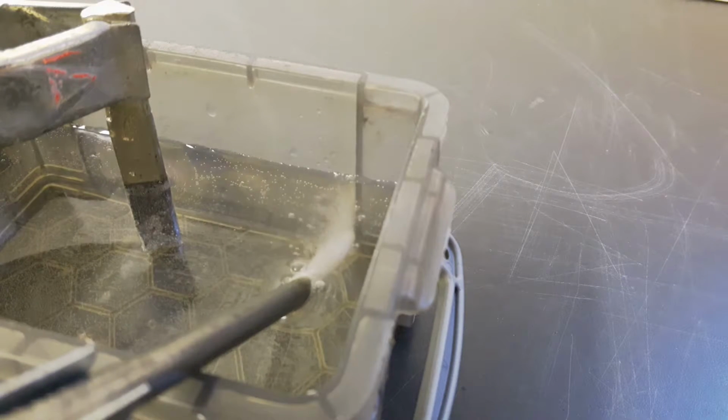You see I modified the setup, and basically we are running on 5 watts at the moment, 5 volts and 1 amp, and there is pretty nice hydrogen production. I checked it for tin, but there is no sign that tin is being electrorefined, so I hope we are lucky.